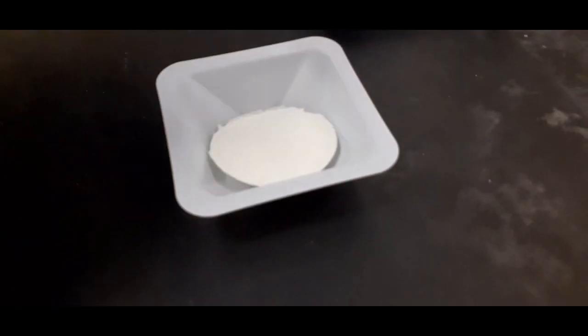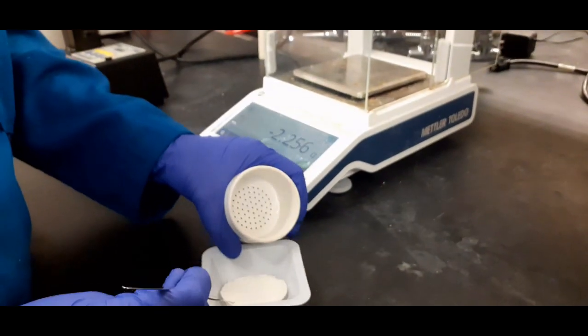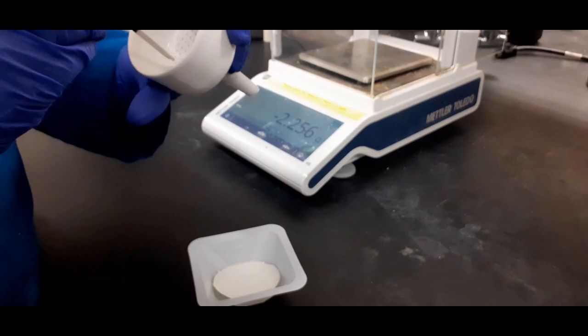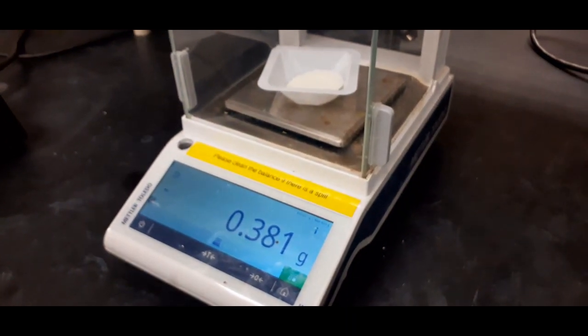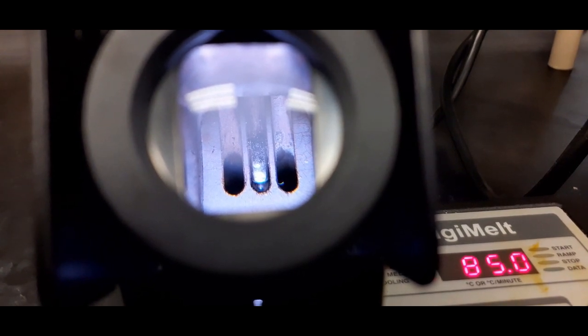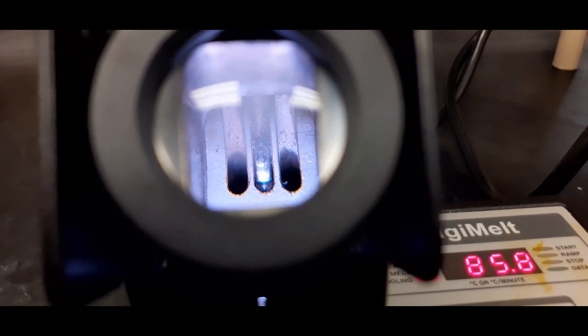Note the weight of the crystals with the filter paper. Note the melting point of the crystals.